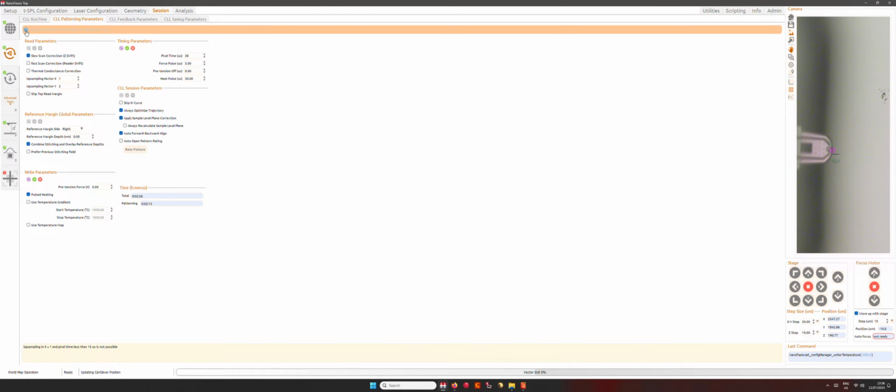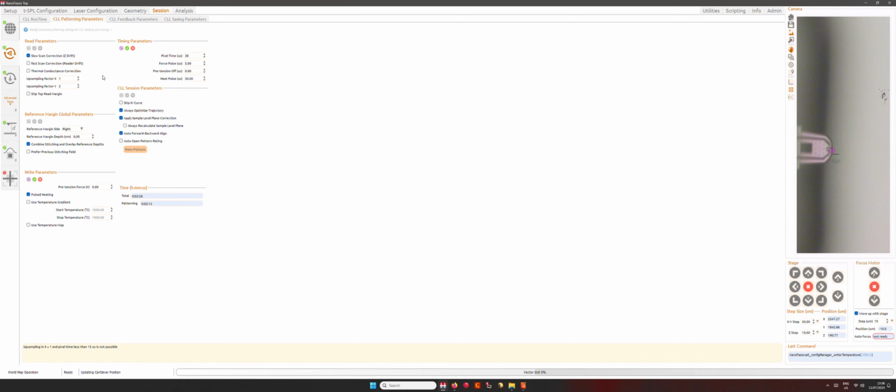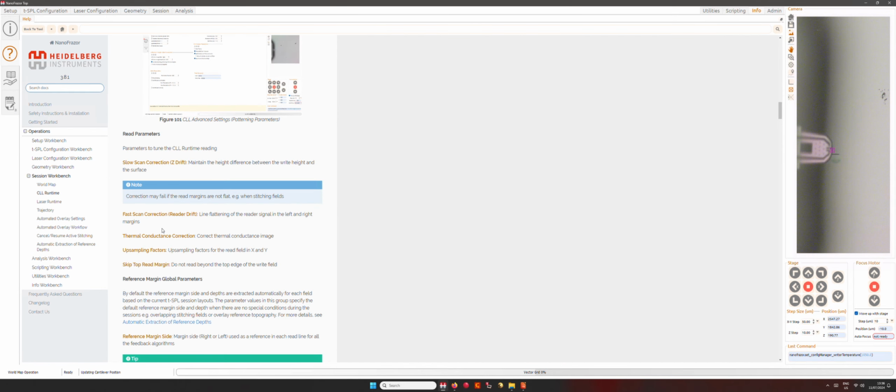Well, if we use the question mark as for many parameters that you can see here, you can see a quick explanation in the user manual. So here it says the slow scan correction maintains the height difference between the write height and the surface. It's just one sentence, but it says it all, and I would like to show you more in detail with a couple of slides what this means and why this is needed.